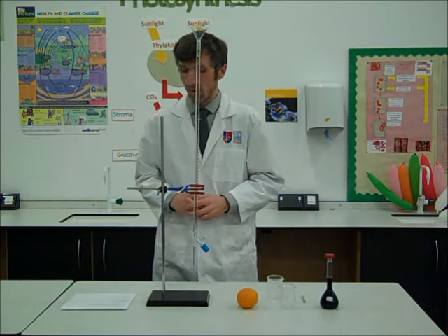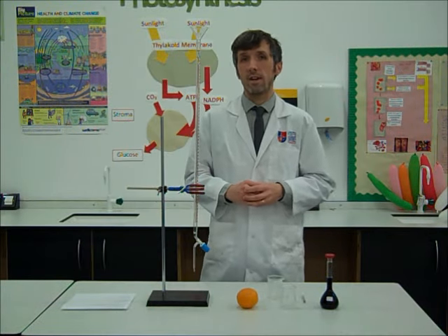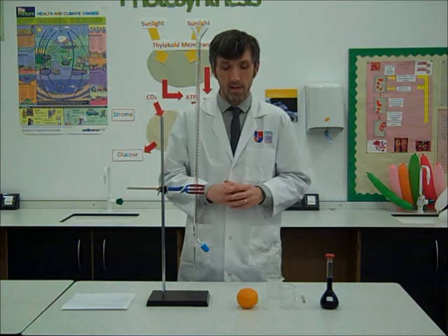Hi, and welcome to the Final Core Practical. We're going to look at how you can find out the vitamin C content of a particular food.